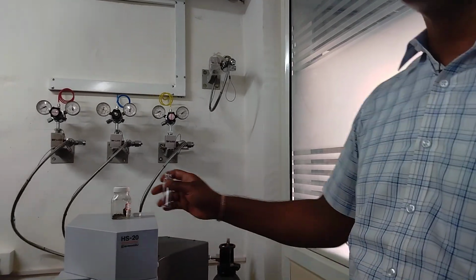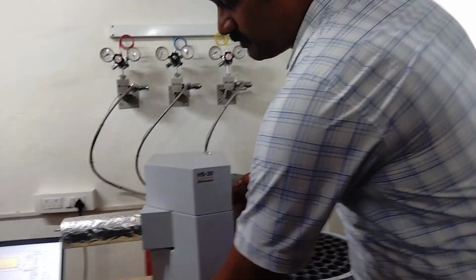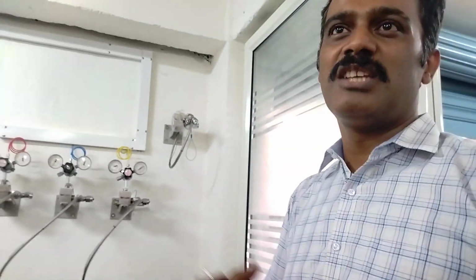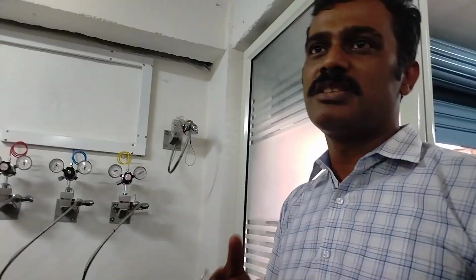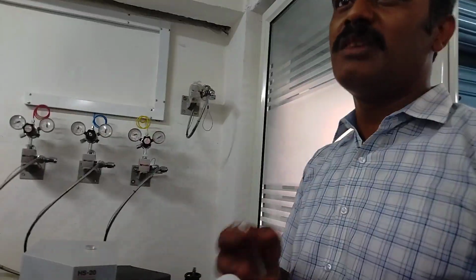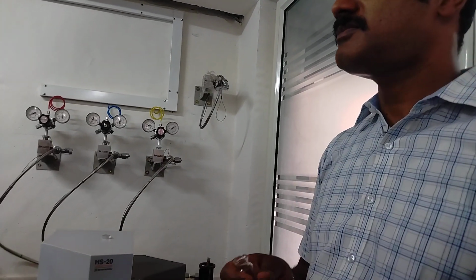Okay. There is a 1 ml loop present in this for solvent residue. Here universally it is always a 1 ml loop we use. That sample will be collected in that 1 ml loop and then transferred to the instrument. This is again a safer technique because in liquid, if there is a viscous sample like that, if any contamination is there, then it may damage the column also. Here only vapor will be transferred. Chances of contamination will be less in this.